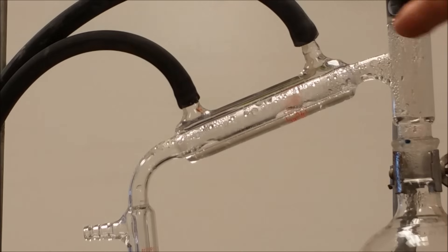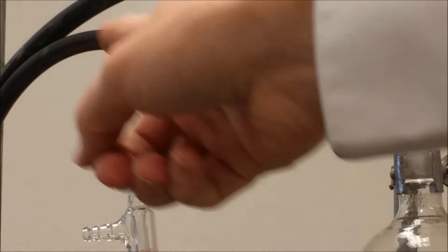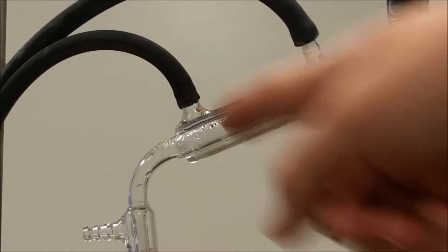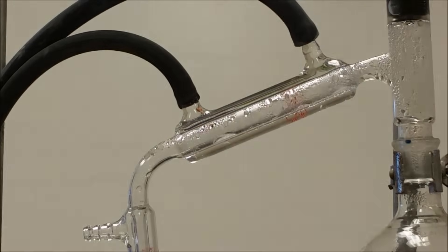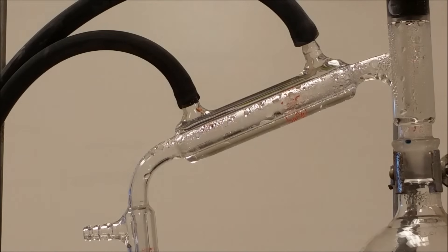The inner tube is connected to this apparatus. The outer tube just hooks up to the water, so we get cold water running along the top, and then you can see the liquid condensing on the inside of the inner tube that drips down, and that's your distilled, separated water.